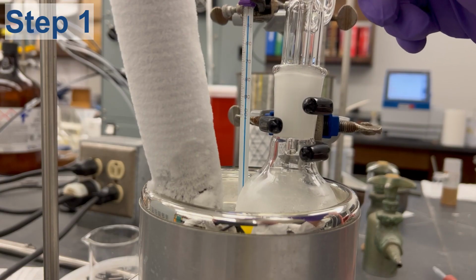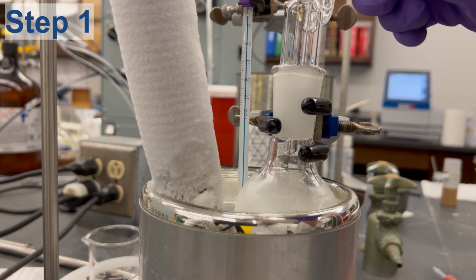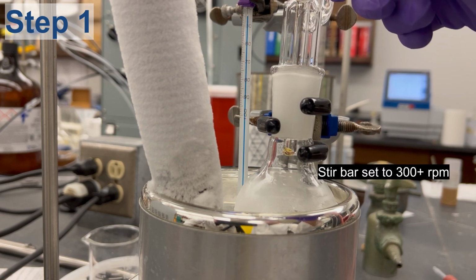To initiate the reaction, slowly open the stopcock of the addition funnel and add the Grignard reagent over 30 minutes. Make sure the stir bar is stirring throughout the whole addition.